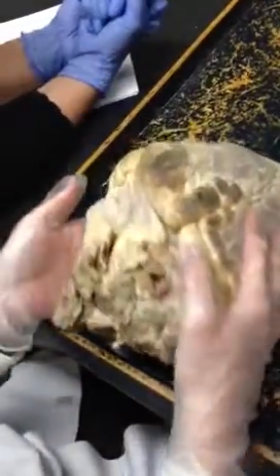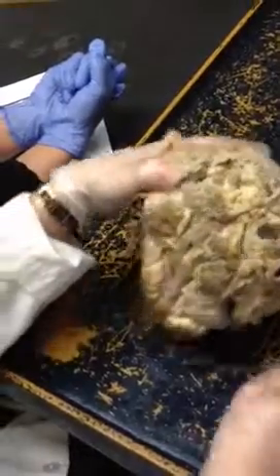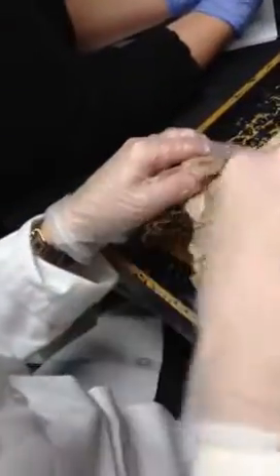The bigger of the two openings is the aorta, and on the back — the ugly side — we have the superior and inferior vena cava. That's where it was hard to find them.